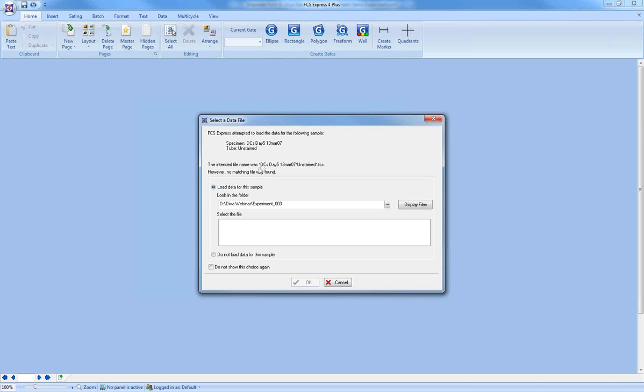It's specifically looking for a file that includes, in order, the name of the specimen along with the name of the tube. In Diva version 6 and previous, all of these files that got exported using export FCS files were specifically named specimen_tube.fcs. As of Diva 7, you now have more options. I'll show you what the dialog looks like in a moment, but you can include other options. So in order to complete this import successfully into FCS Express, you need to at least include the specimen and tube, and then you can include any other information as well. That's why you see the wildcard marker here, the star. As long as you have the name of the specimen and the tube, it's going to work.